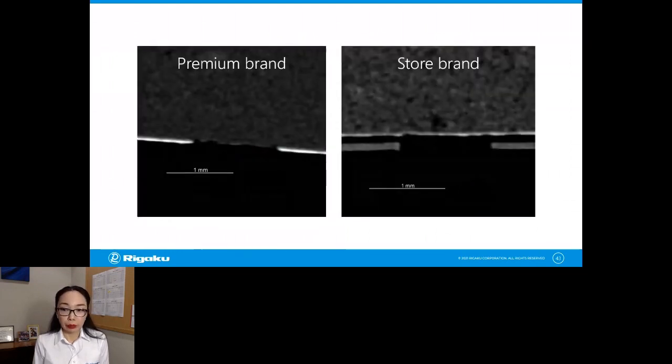So the premium brand, again, has this coating and there is a clear opening of the coating. The store brand has the coating everywhere. I don't see any opening whatsoever, but it has those kind of sleeves on top of the tablet, which is making it look like there is an opening, but there is really no opening. So this is another type of difference you can easily see.